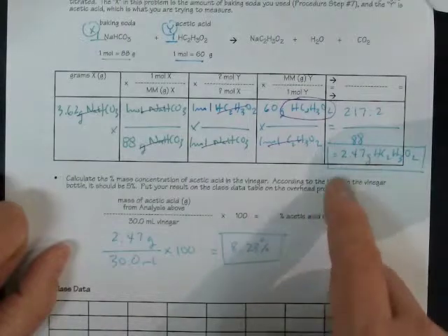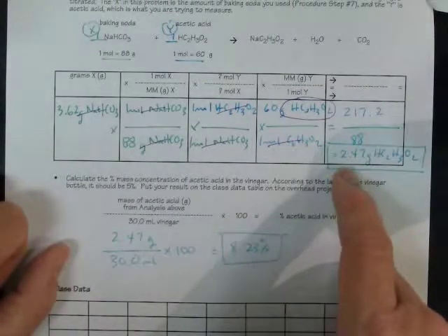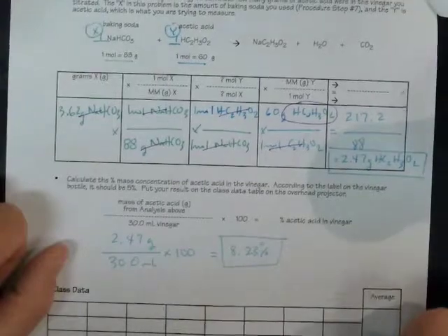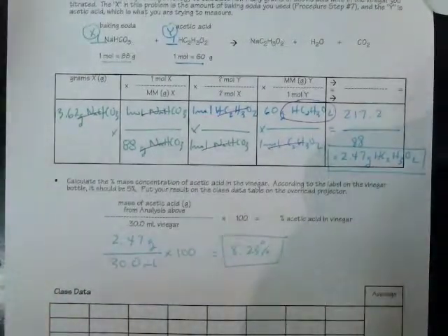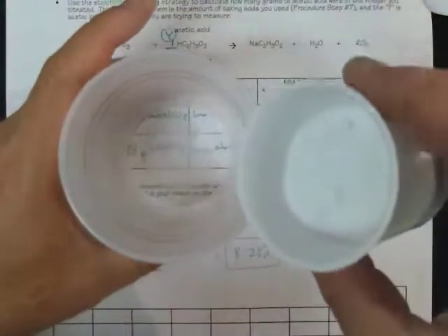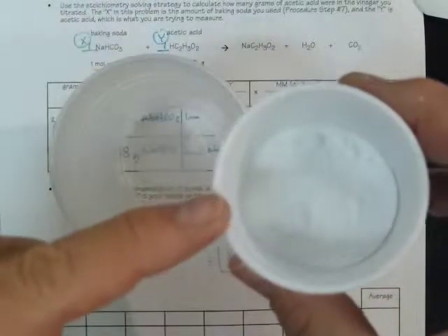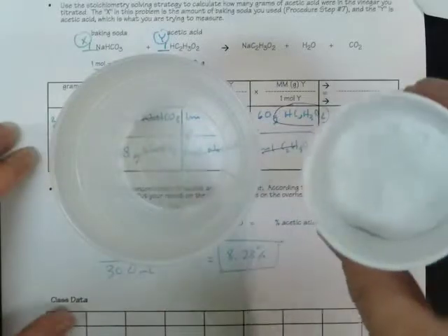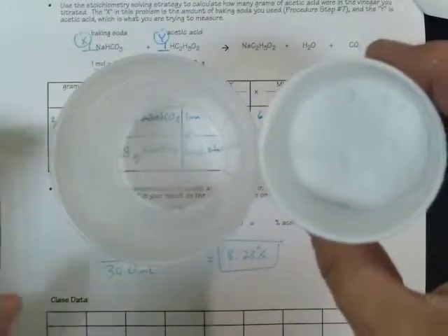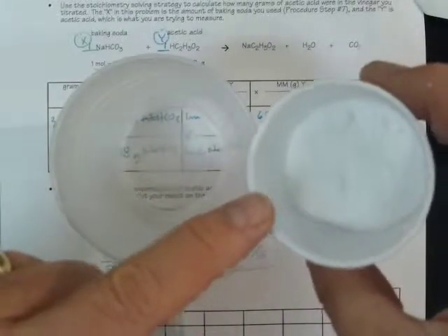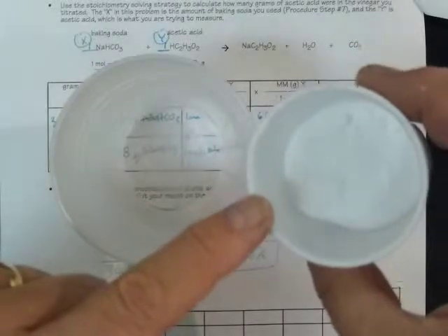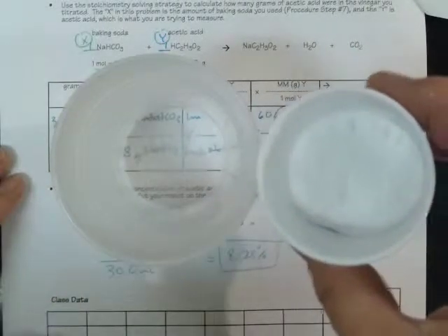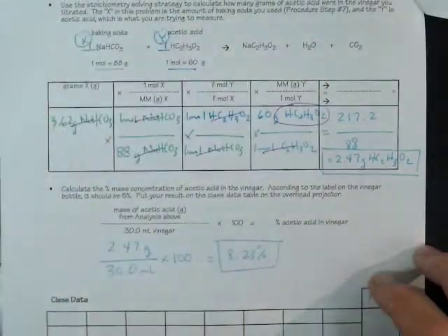There's a better way to do this where we add instead of little taps of baking soda, which in terms of molecules and units of compound is a very big step. There's another way we can do it by dissolving the material that we're adding in water and adding it a little bit at a time as a solution with more control over the amount that you're adding. That's what we're going to do in our next experiment to practice volumetric technique of titration.